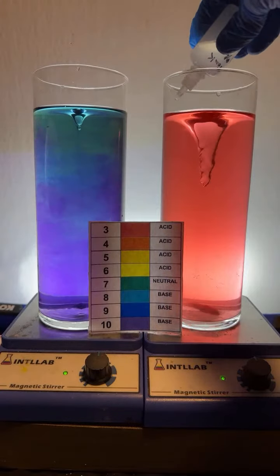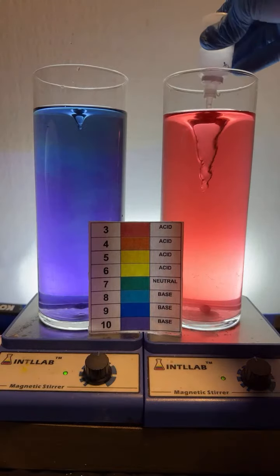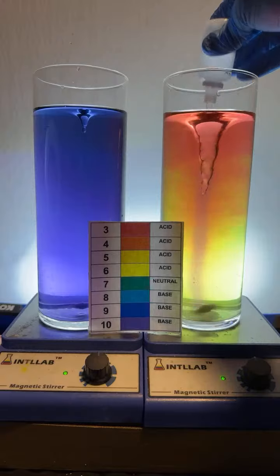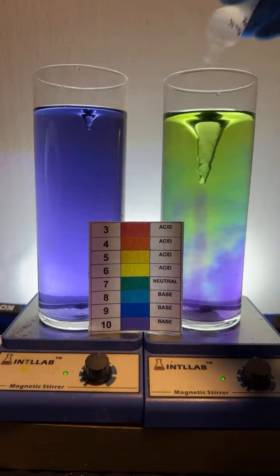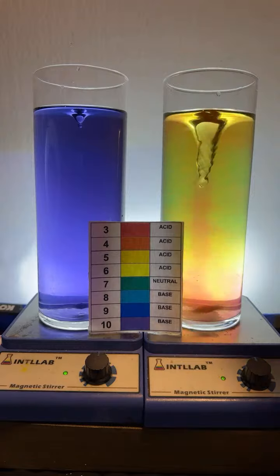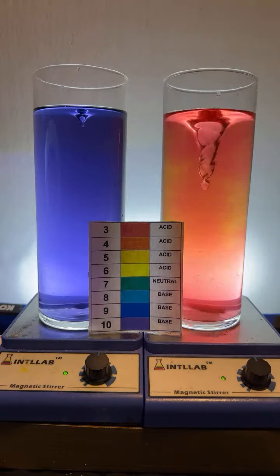Here I'm going to add a drop of base to see if we can get the rainbow effect. Are you ready? Here we go. One, two drops. Let's see if we get it. I better add a little bit more. Kind of. Not as good as I'd like. We're going to try that again. Let's add a bunch of acid here. Get it back. We're getting flashes of it, but every once in a while we get all the colors of the rainbow simultaneously. I love it when that happens.